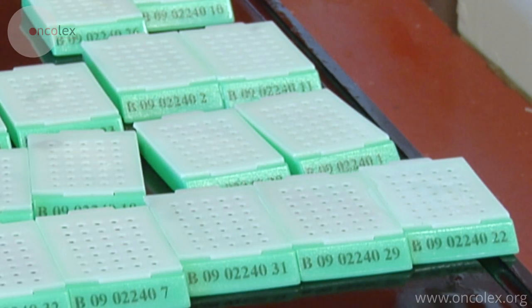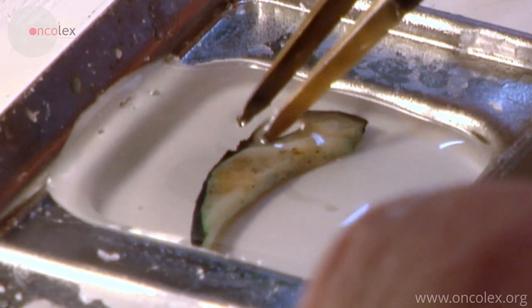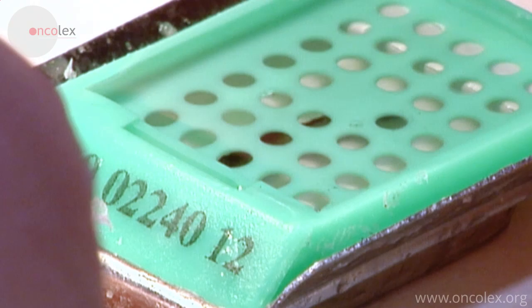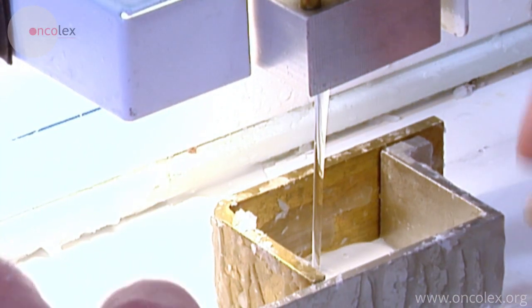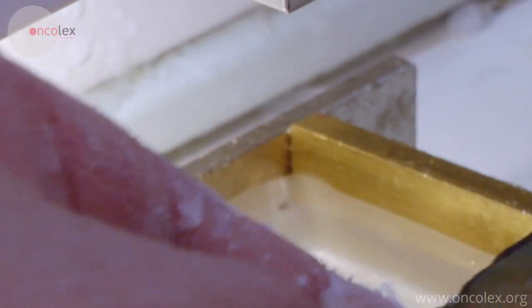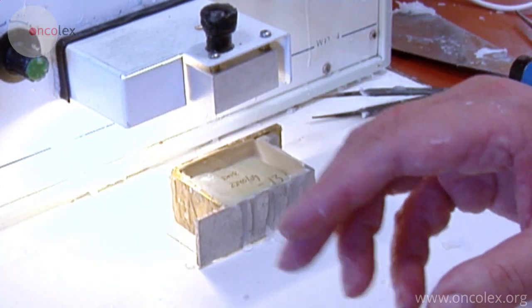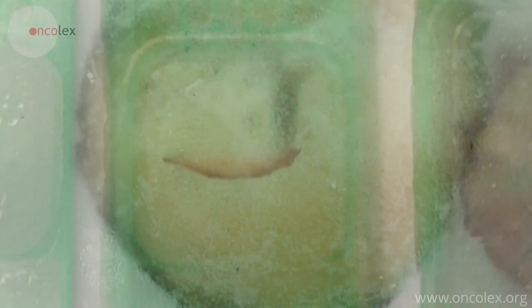After tissue processing, a biomedical engineer embeds the containers in paraffin. The slices must be placed level in the paraffin to facilitate optimal sectioning. A mold is filled with hot, liquid paraffin and the slice is placed level in the paraffin. The container is placed over the mold and more paraffin is added. For the large slices, a custom mold must be made using two angle bars. The containers are left to cool and are kept in a freezer until sectioning.